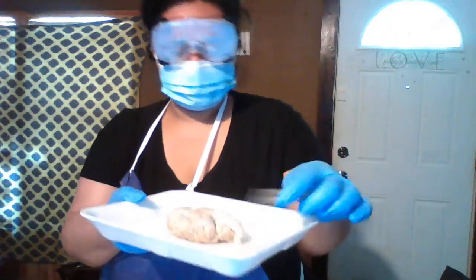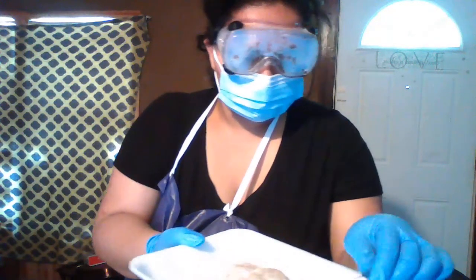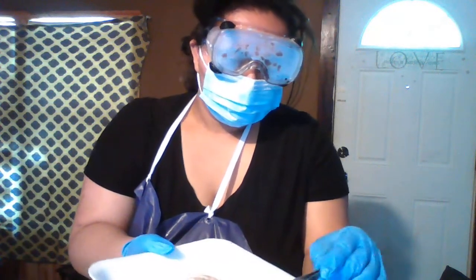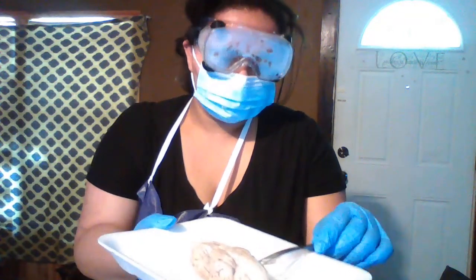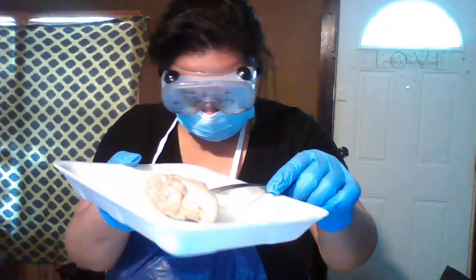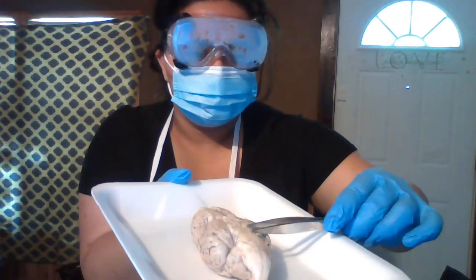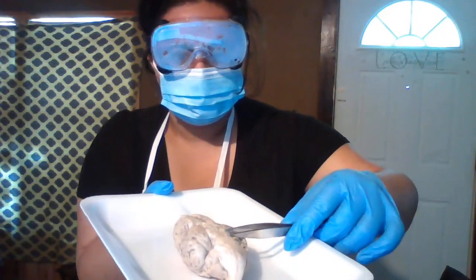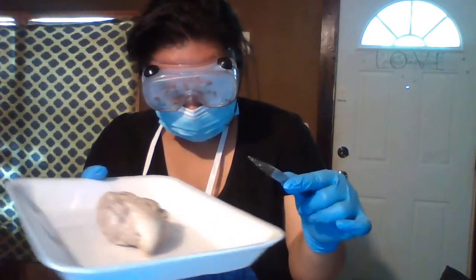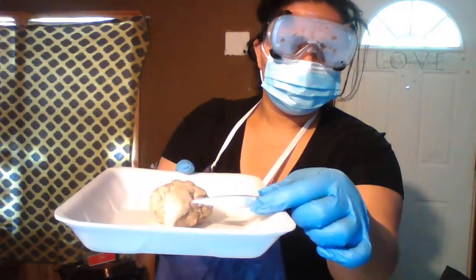I'm going to do this a little backwards, y'all. Excuse my cough, it's allergy season. Right here, connected to your brain, is your brainstem. You'll find the medulla oblongata, and then right here above it is your pons. The midbrain is somewhere on the side section.